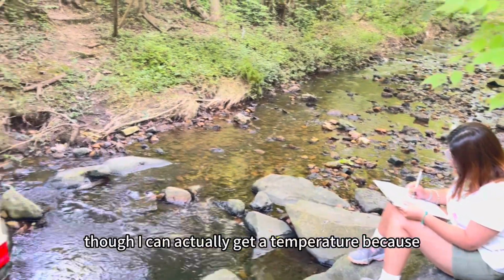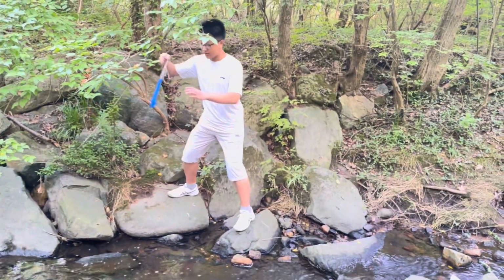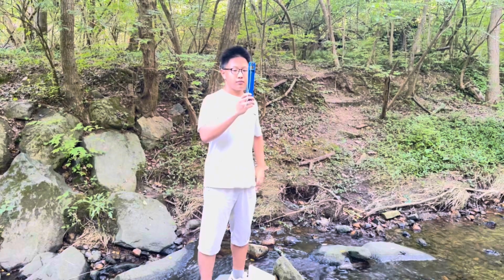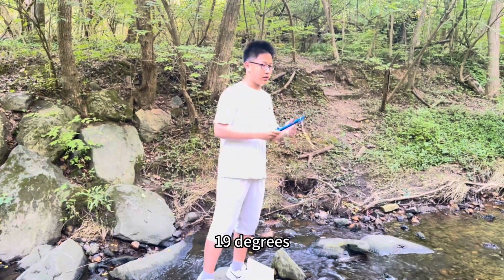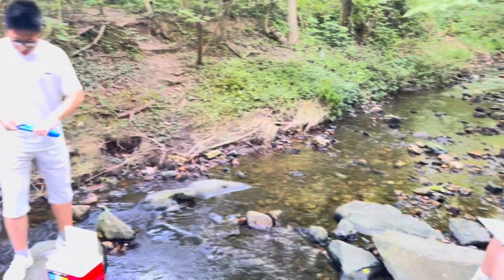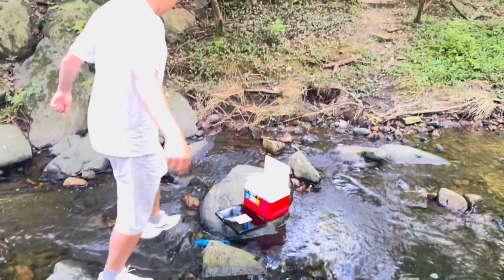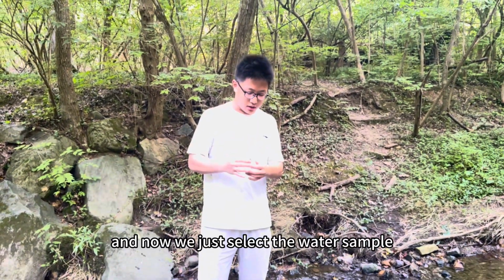Now I can get the air temperature. The air temperature is 19 degrees Celsius. And now we just put this in the water. Okay, just put it through. Yeah, that's good. It won't wash away. And now we just collect the water samples.